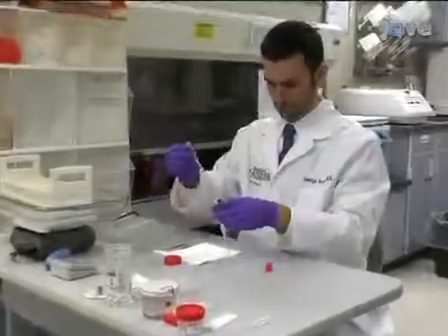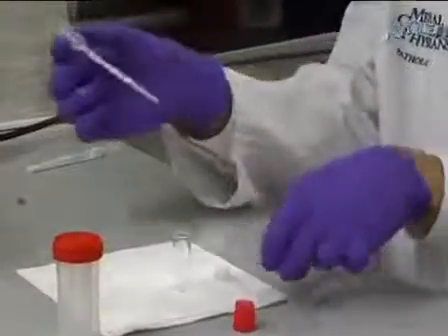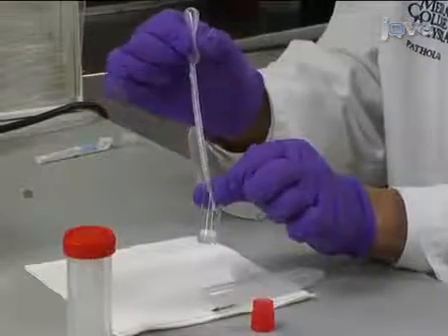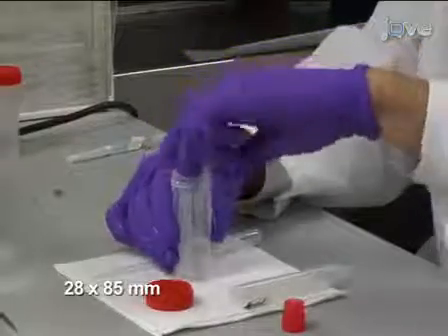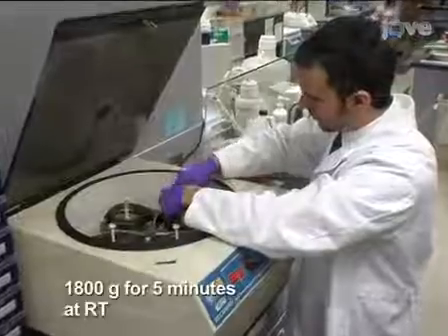To begin this procedure, transfer about 0.5 milliliters of the preferably concentrated specimen to a 45 millimeters long flat bottom glass tube with a 15 millimeter diameter. Next, place the glass tube into a large flat bottom plastic carrier tube and centrifuge at 1800 G's for five minutes at room temperature.